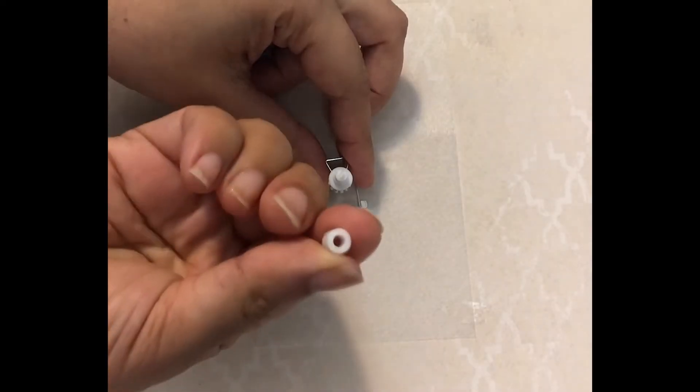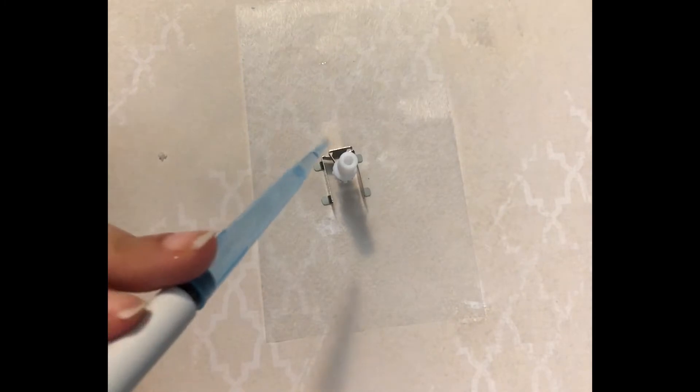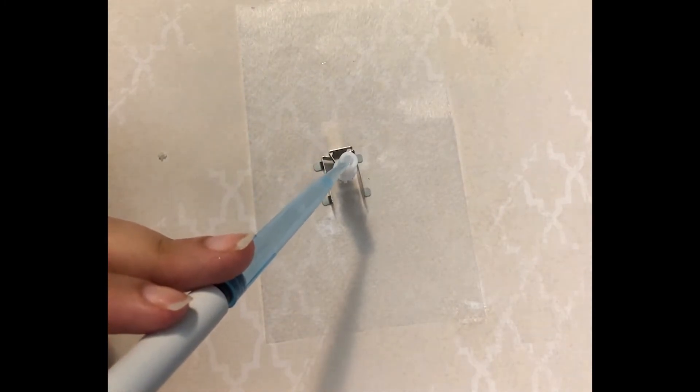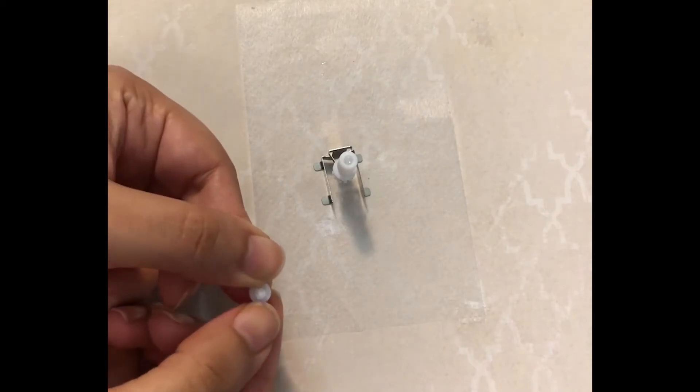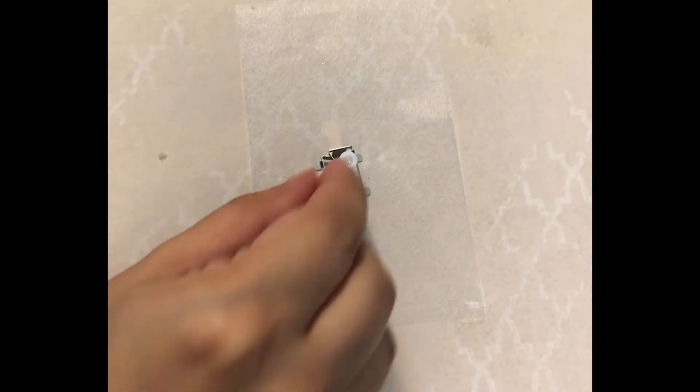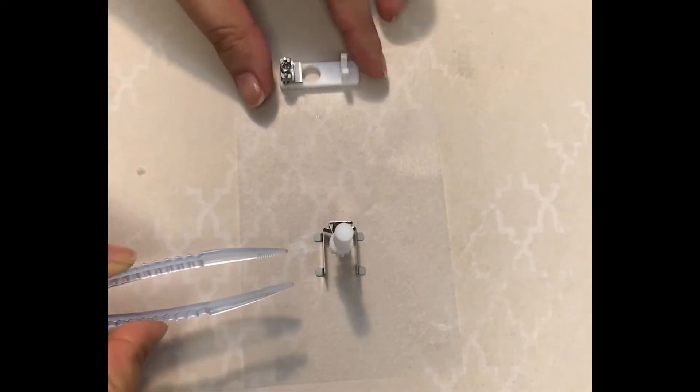Clip on the mold. Add low melting agarose or phytogel into the tube. Close the tube with a protruding cap to make space for the sample. Allow the agarose or phytogel to solidify for at least 20 minutes and then slowly remove the plastic attachment.